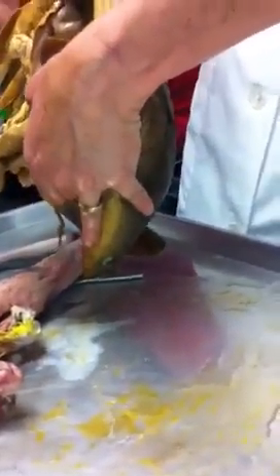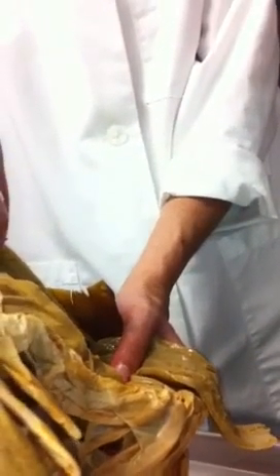Out of the way. And you guys will see two testes way anterior in the body cavity of the shark. See that? With that stuff? Yep, those two large, really anterior organs are the testes. Yep. And you want to see it?